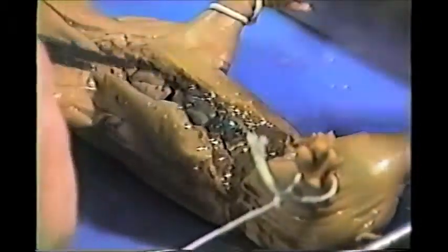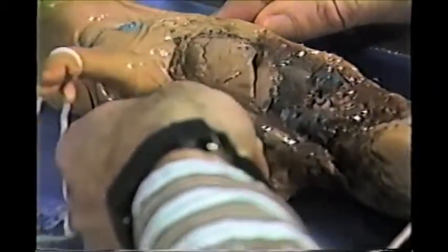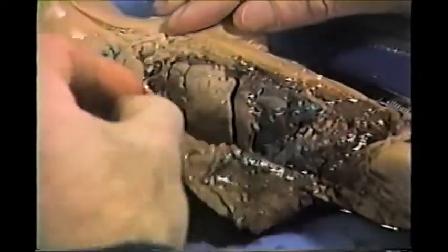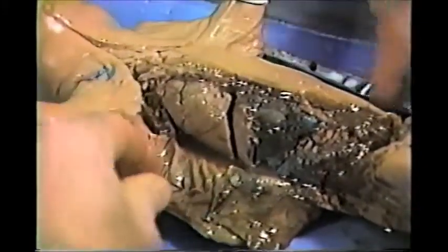Okay. Now, then you could turn this and cut underneath the arm and here near the thigh. Hopefully your pig won't have all this mess, but one never knows. You're going to need to just break the ribs a little bit, and there are dissecting pins that you use to insert and hold that flap down into the rubber of the bottom of the tray.